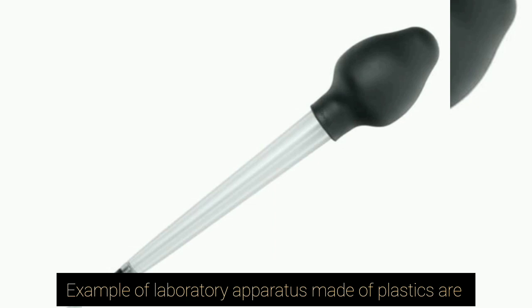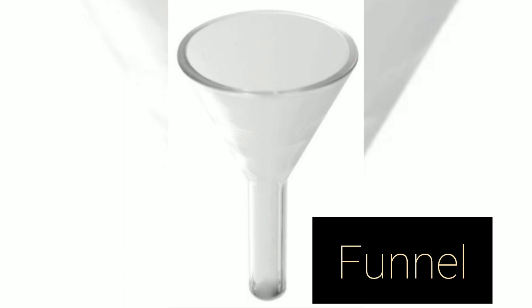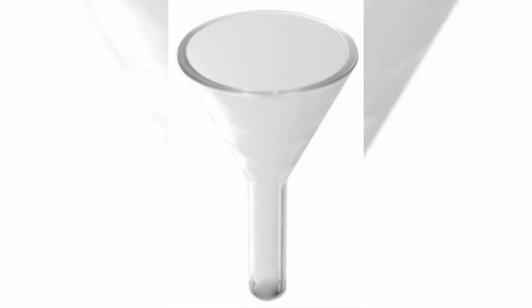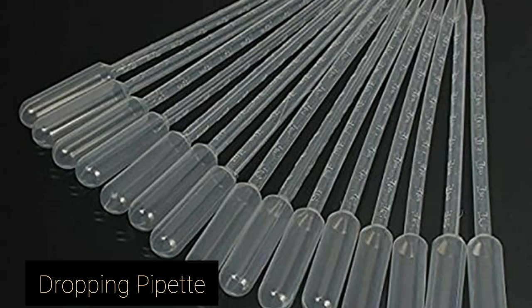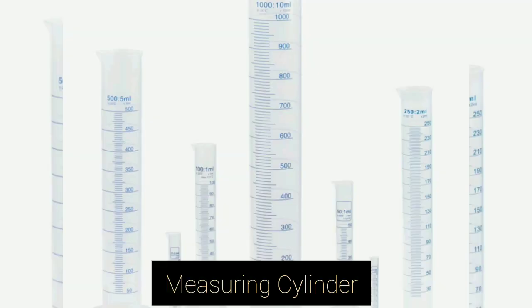Examples of apparatus made up of plastics are a wash bottle, funnel, though some of it are also made up of glass. We have the dropping pipette. When you look at the tip of the dropping pipette, it's made up of plastic. Measuring cylinder as well is made up of plastic, while some is made up of glass.